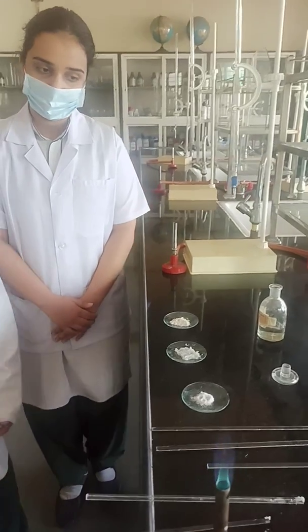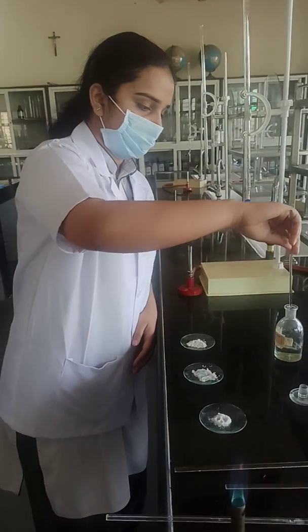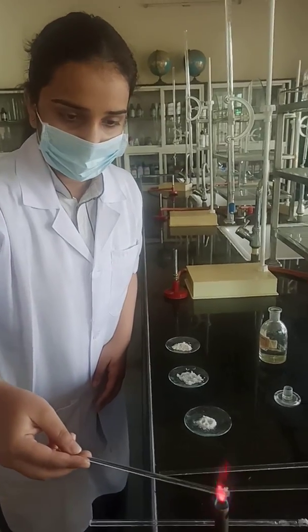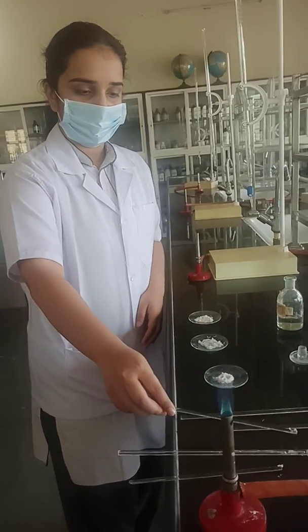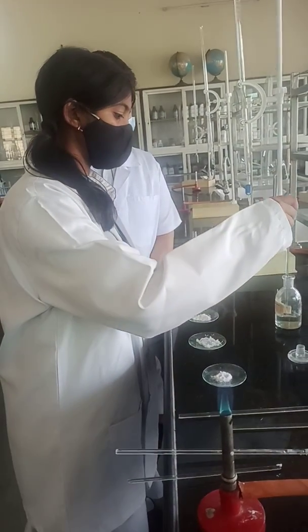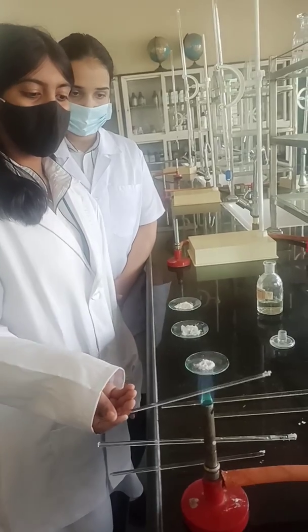Now Bhavishya will take a glass rod and show the flame test for the second radical — strontium. Dip your glass rod in the HCl, take some salt on the glass rod, and bring it to the flame. This is crimson red — Shabash! This is crimson red colour. Can you repeat, Asmi? Again dip the glass rod in the HCl. This is the crimson red colour.